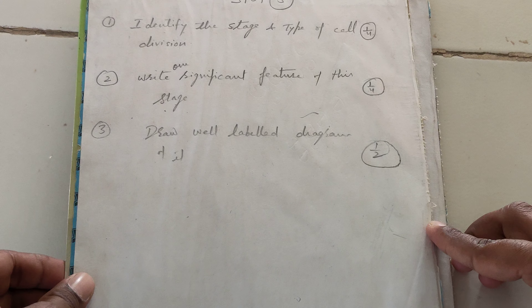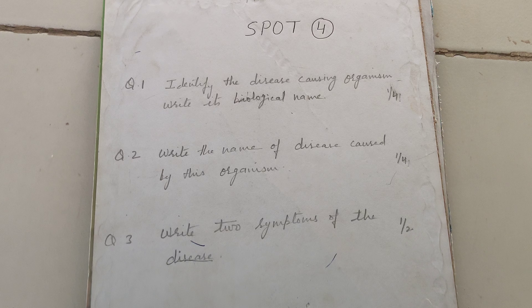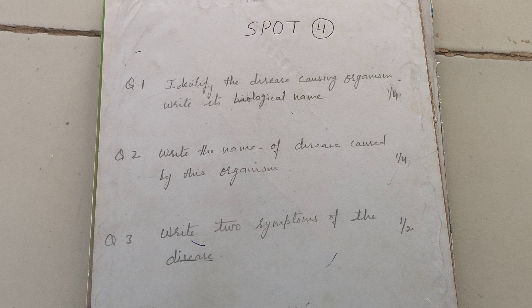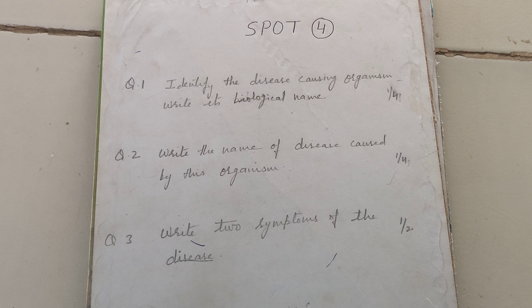In the third spot, it will be a slide of cell division. You will get one slide showing one of the different stages of cell division. First, you have to identify which stage it is, then write one significant feature of that stage, and after that draw the diagram of that stage.